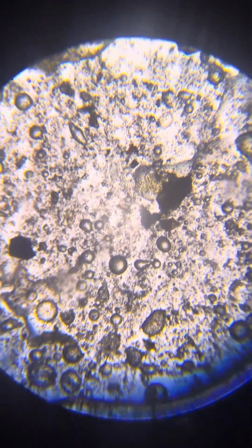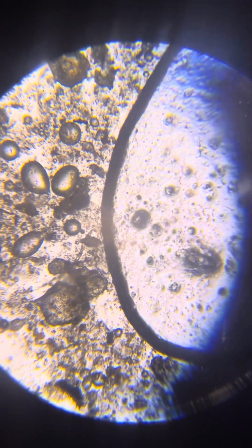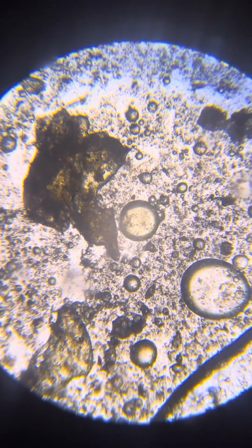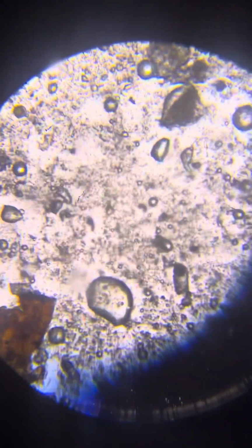These are like the hollow snakes that you see. This is a nice one actually, the one with the yellow belly.